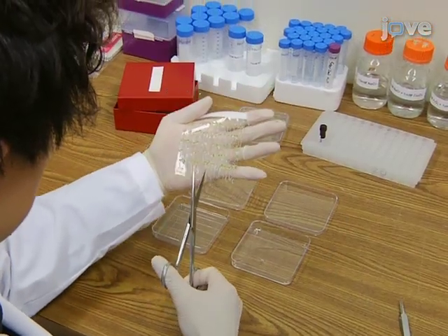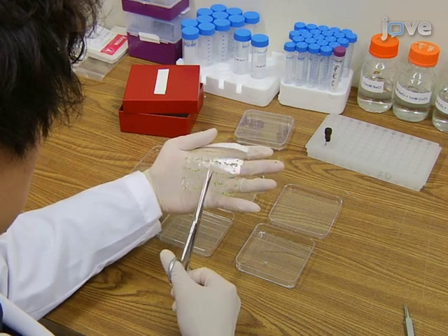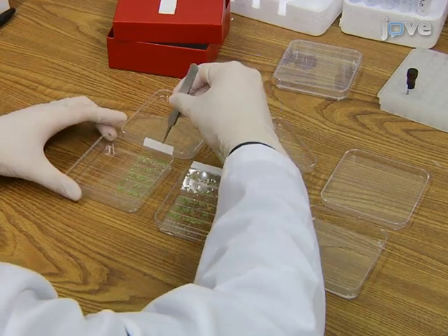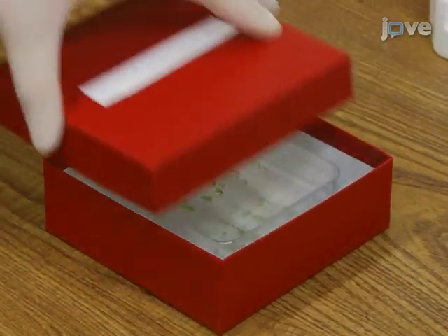To prepare for luminescence imaging, take the film out of the HCTZ solution and cut it down the middle to form 2 pieces. Place the 2 pieces of film with the seedlings facing up in 2 different plates. Then, leave the plates in the dark for 5 minutes.